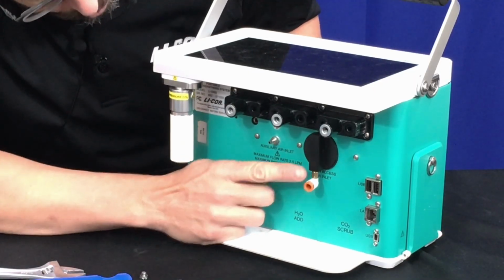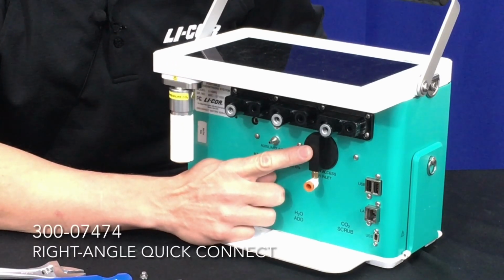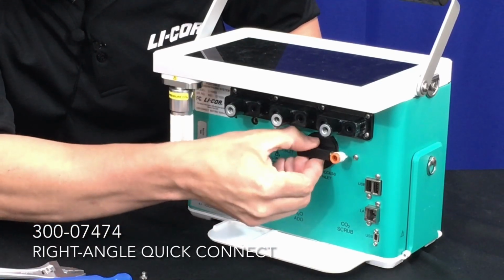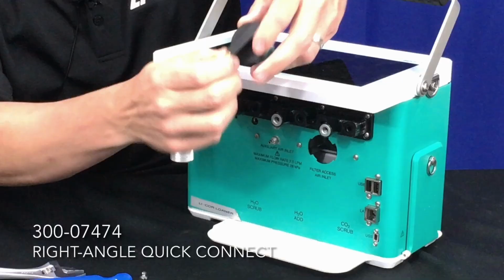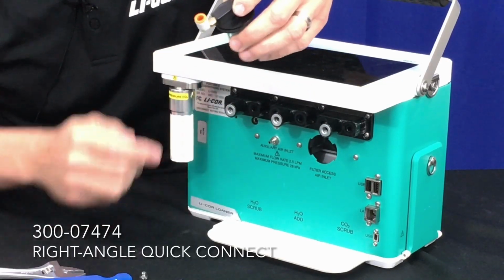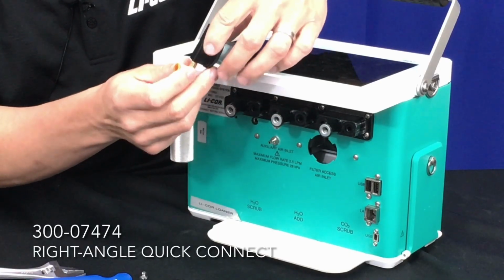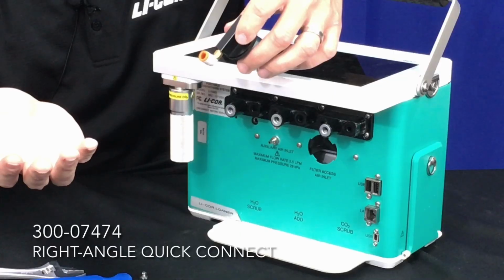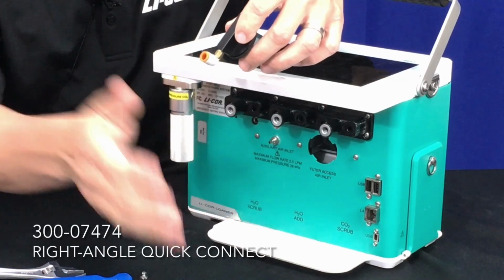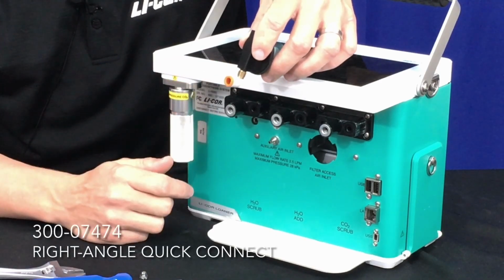Similarly, if you were to choose to want to have the ability to scrub CO2, then you would add this hose barb at the bottom of the filter here, which just threads into this part right here. And in this option, because the pump will still need to be active, the typically best way to set this up is to have a T right before this, such that your tank is supplying more air than the console needs, and the console pump will pull air from that airstream.